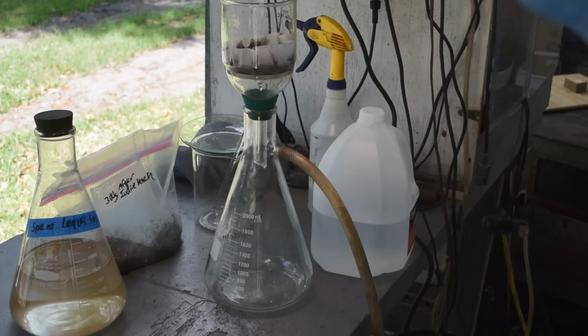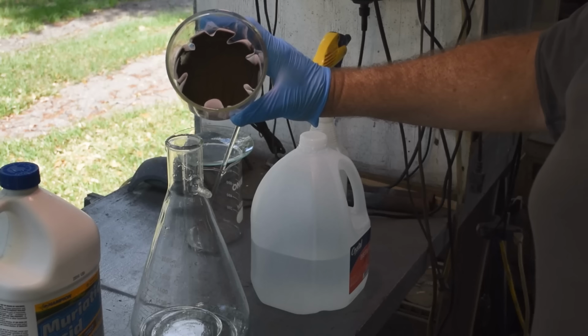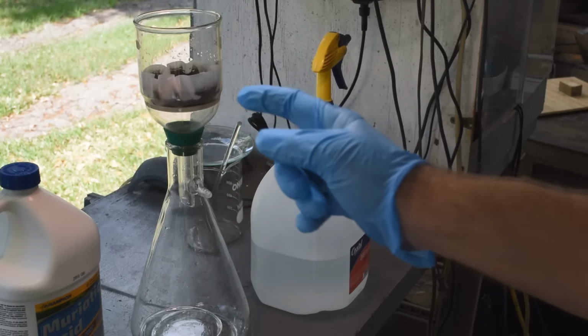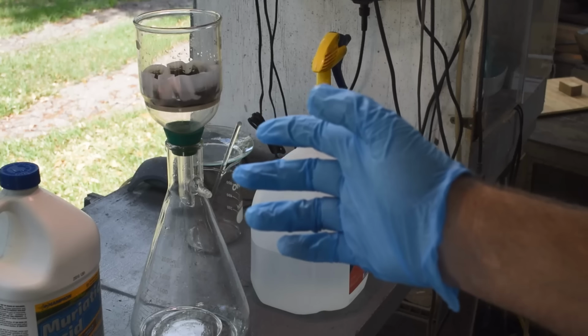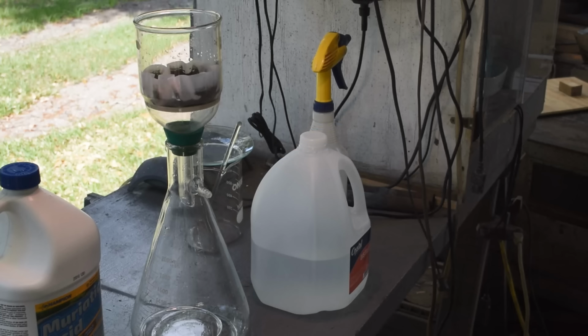From here on out, it's just like I've done it all the other times with the iodine leach. So it's really no different at this point. We'll see how much gold we get in the end. All right, so our mud is up here. I have pulled a lot of distilled water through it to get the leach chemicals out of it. And that mud consists of metallic hydroxides and our gold. So I want to get the metallic hydroxides into solution. The gold won't go into solution with what I'm going to do next, but the metallic hydroxides will.